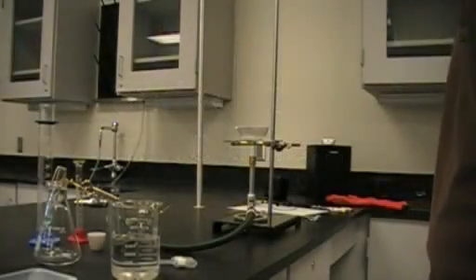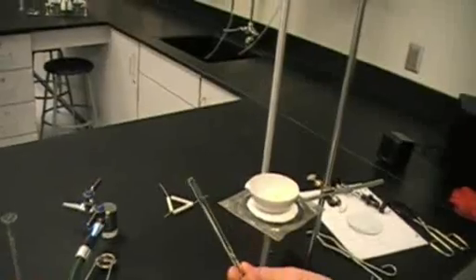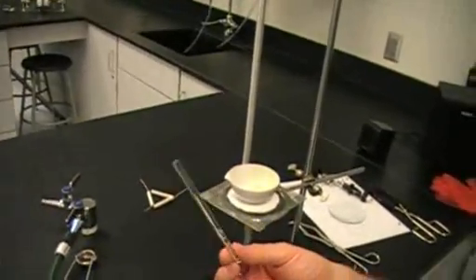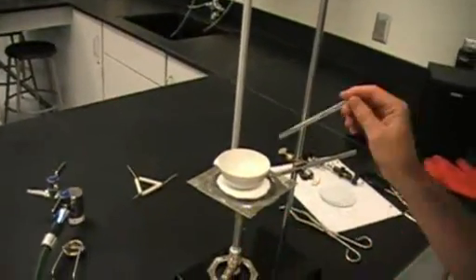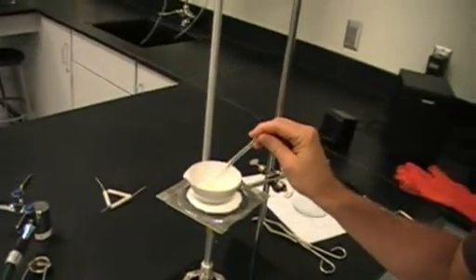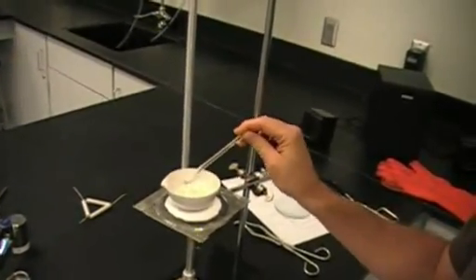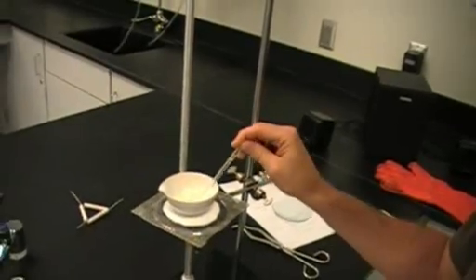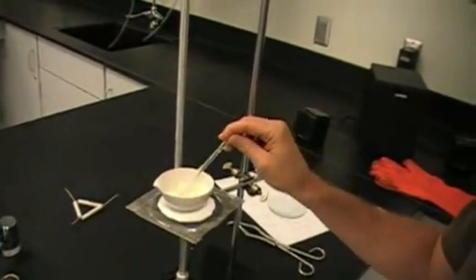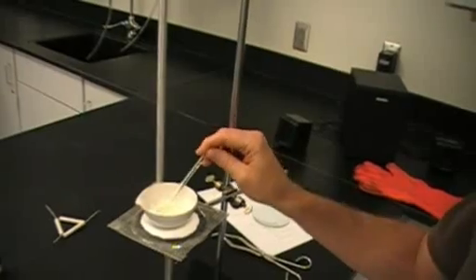All right, this has been heating for a little bit. I am going to try to raise the camera up. And really the last thing is, this is just a glass rod. And this is just used to kind of poke at stuff. Usually in the case when we are evaporating, we are trying to just break it up and make sure that we kind of get smaller chunks, to get whatever liquid we are trying to get out of there off. You can kind of see gas coming up. That gas, which is why we started this in the fume hood.